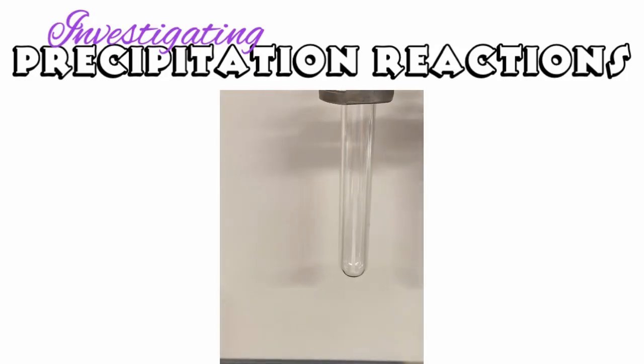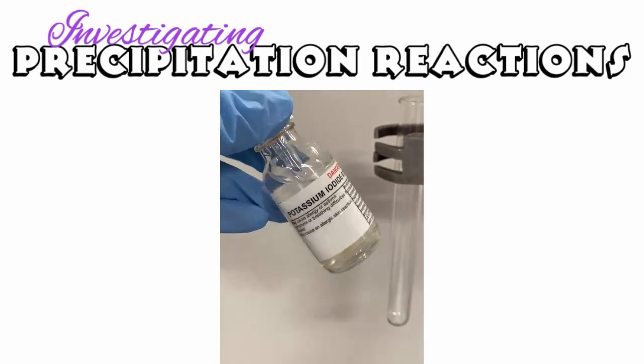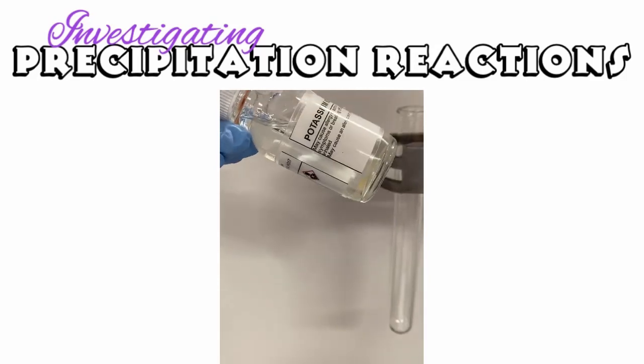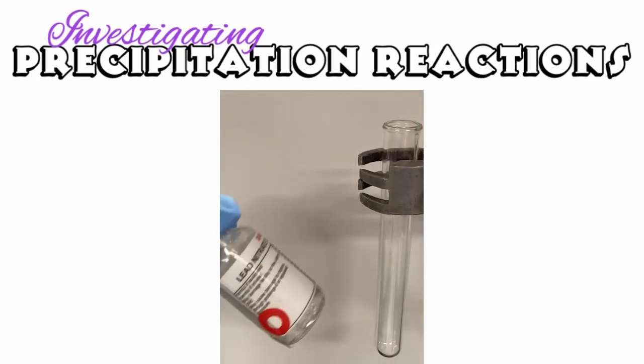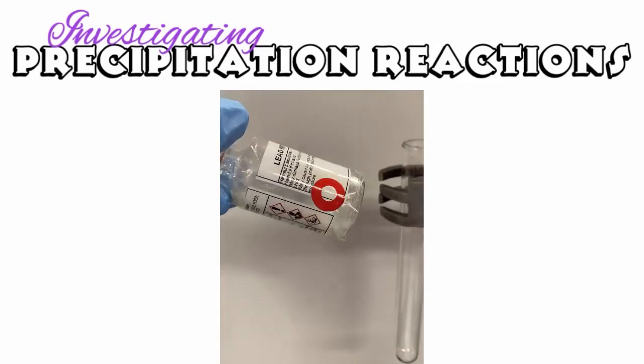Okay, so now for my favorite ones. In the classroom, this should be done as a demonstration only because of the lead nitrate. Students shouldn't be working with that. So this one here, we've got potassium iodide and lead nitrate. They're both colorless liquids before they react. Let's see what happens.